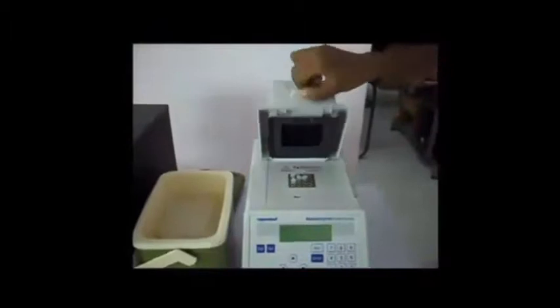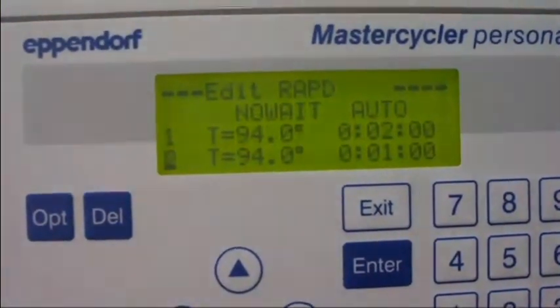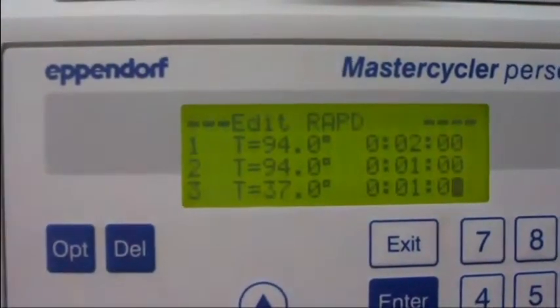Load the samples one by one, and lock the lid properly. Programming the PCR is the critical part that can affect your results. Set the time for each reaction correctly. Annealing temperature is the most important parameter, which depends upon the primer used.